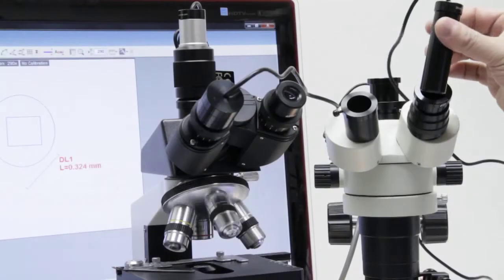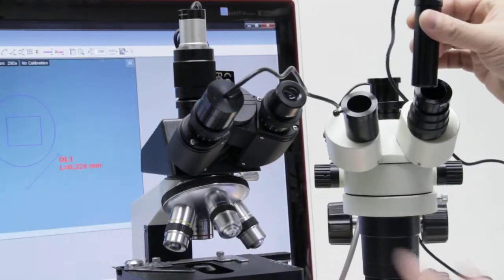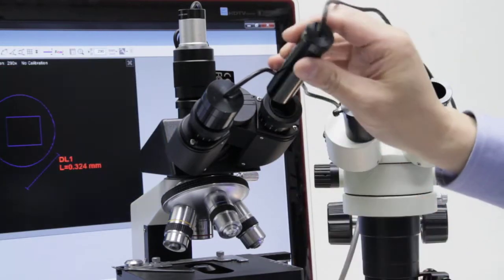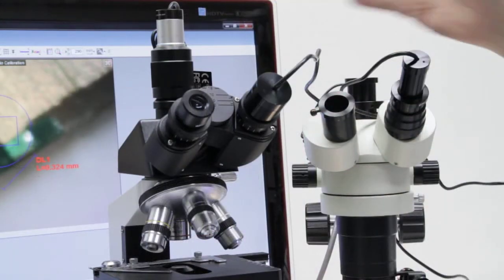The human eye is not the same as an electronic eye or camera, so once you've changed the eyepiece, it may be necessary to adjust the minor focus a little bit to achieve optimum image focus.